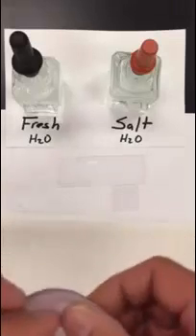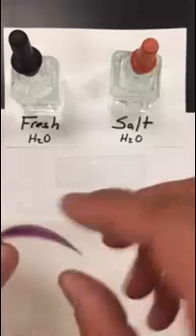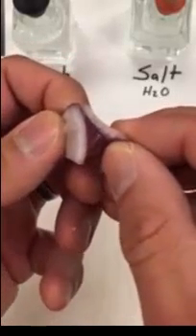Once you've done that you can take your red onion and the best way to do this is this. Flip your onion upside down so the white is facing you and the curve of the onion is pointing down towards the table and you're just going to gently take your fingers and then snap it in half. And when you snap it in half try to peel it back so you can get the red onion film and skin to separate from the actual onion itself as you can see there.